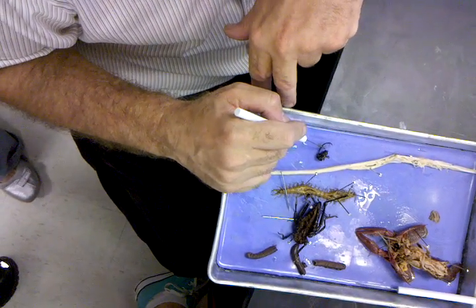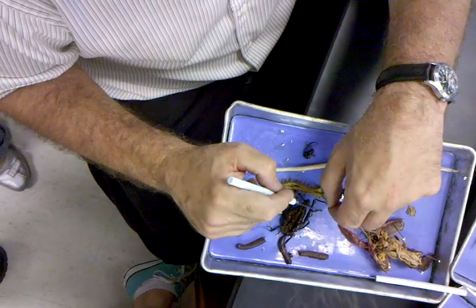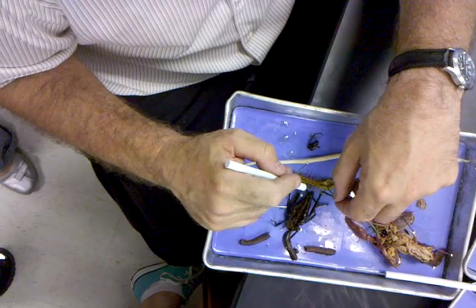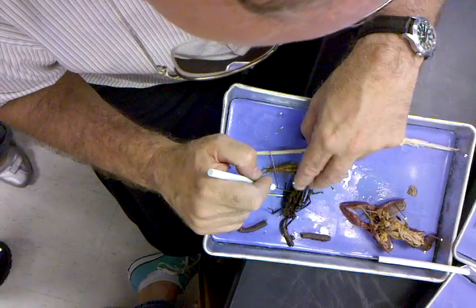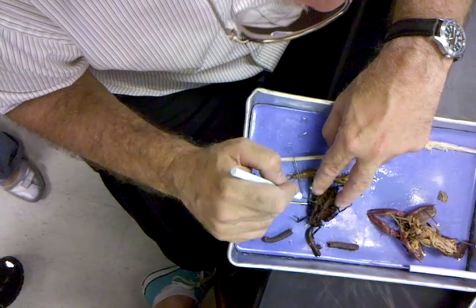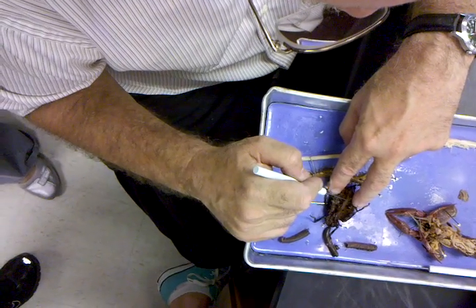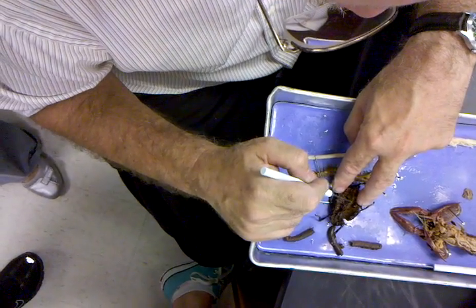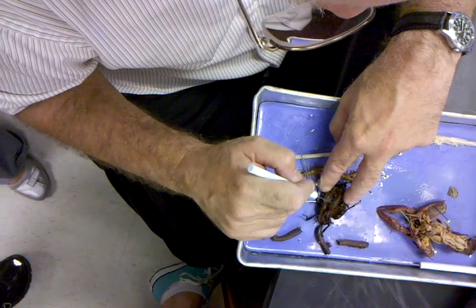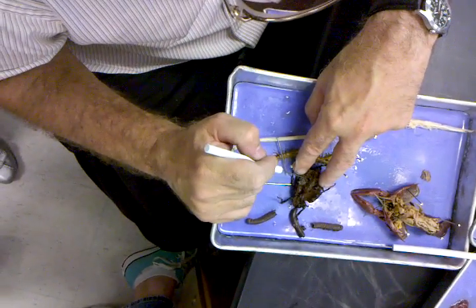Antenna. Compound eye. In anatomy, what would your thigh bone be called? Femur. Here's the tibia. The excretory organs of insects — go back to your notes — are called malpighian tubules. I don't know that I'm going to ask that on the exam, because that would be pretty tiny to find them, but we could tease these malpighian tubules. These are called malpighian tubules, and that's what we've got right here — the excretory organs right there are malpighian tubules.